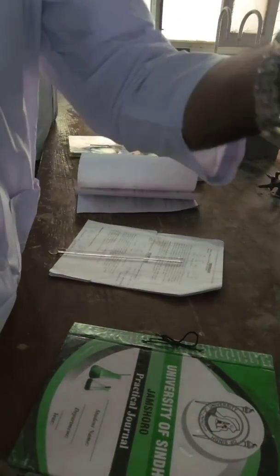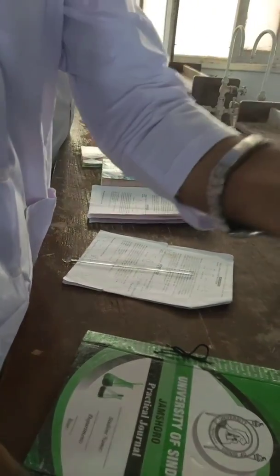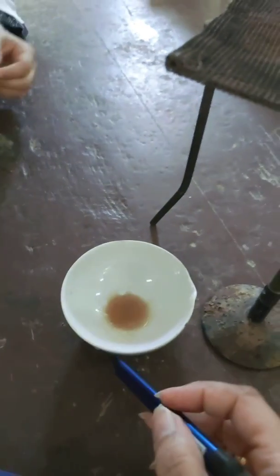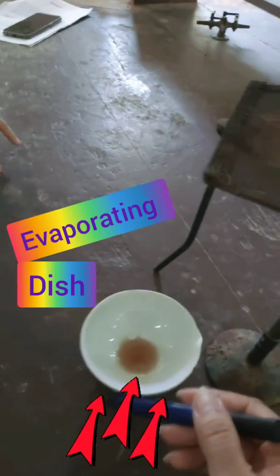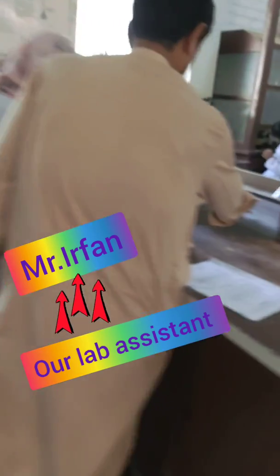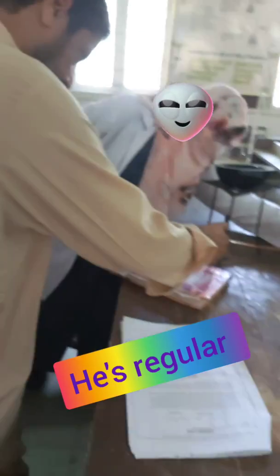I have explained this today to my Part 3 and MSc students, and they are working right now in the lab. These are the boys — they are working. The girls are preparing the experiment in a china dish, also called an evaporating dish, as recommended. This is how they are doing it right now.